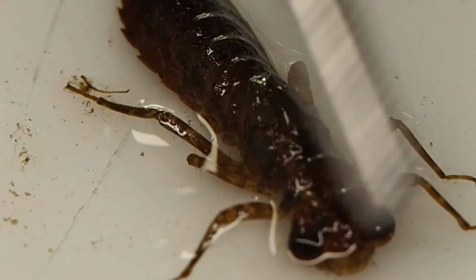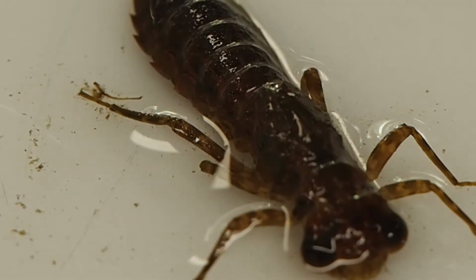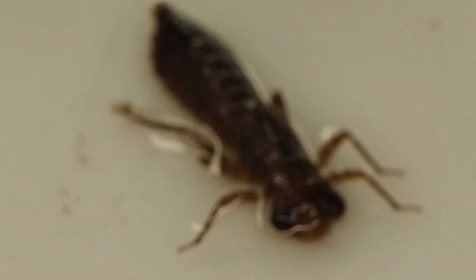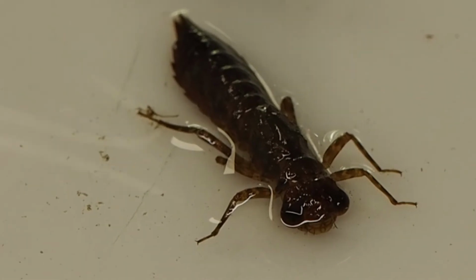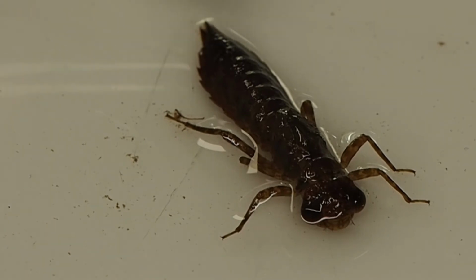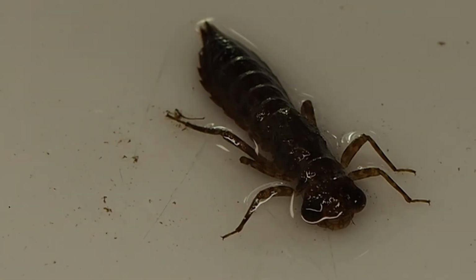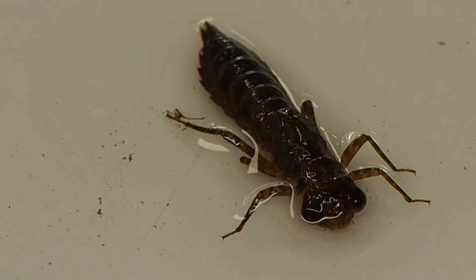So it's very in between, kind of the nostril area. If we turned it over, we'd see there's actual biting or chewing mouth parts, and so it tells us how this animal feeds. The other thing that's distinctive is the long, elongate body, so the abdomen region, and it comes to the tail area, and it has two little pincers, if you like. They're not pincers as such, a two-pointed tail, very short. And so we're looking at the legs, the head shape, the general body shape, and the tail are key features of most of our bugs.